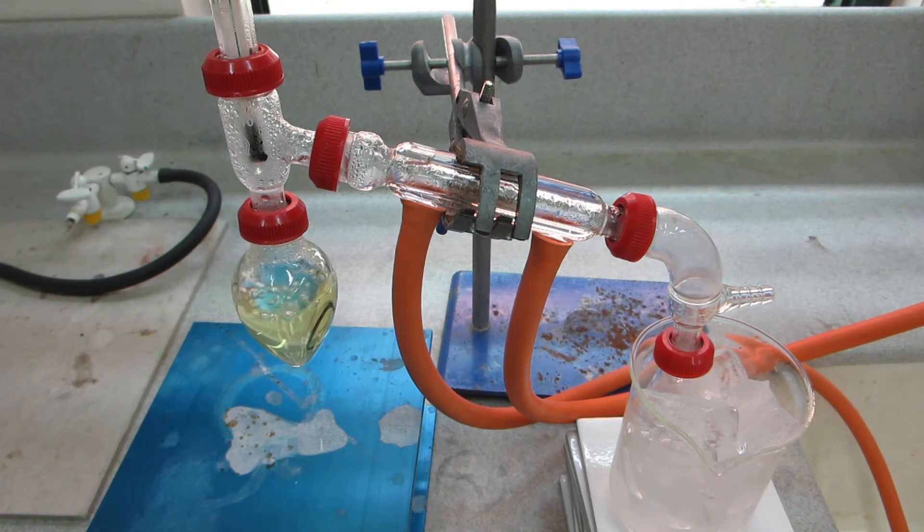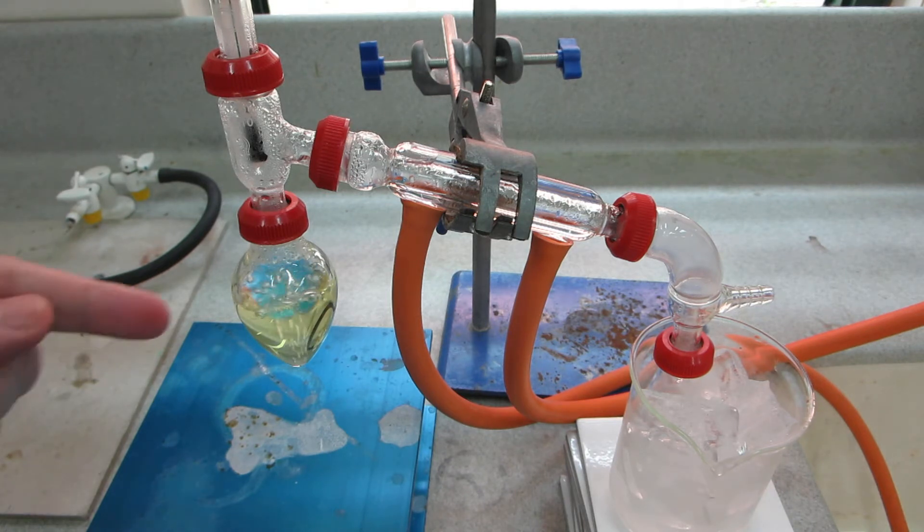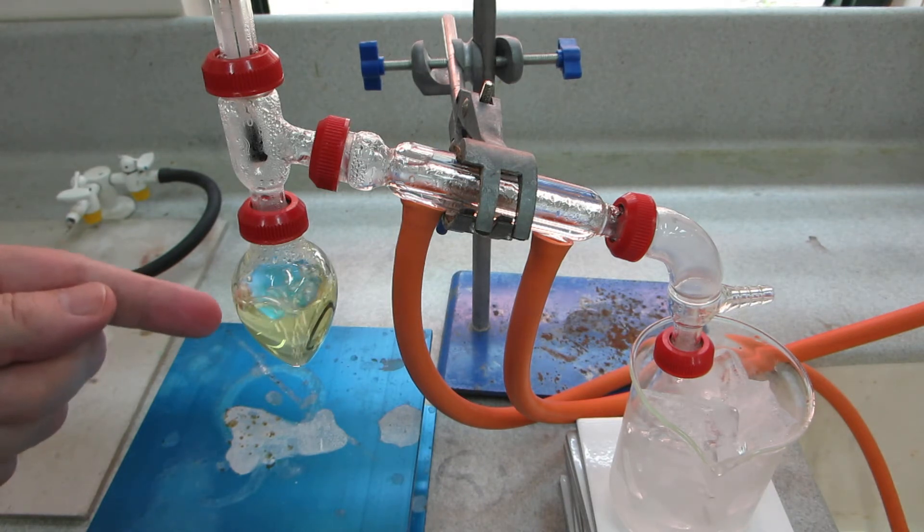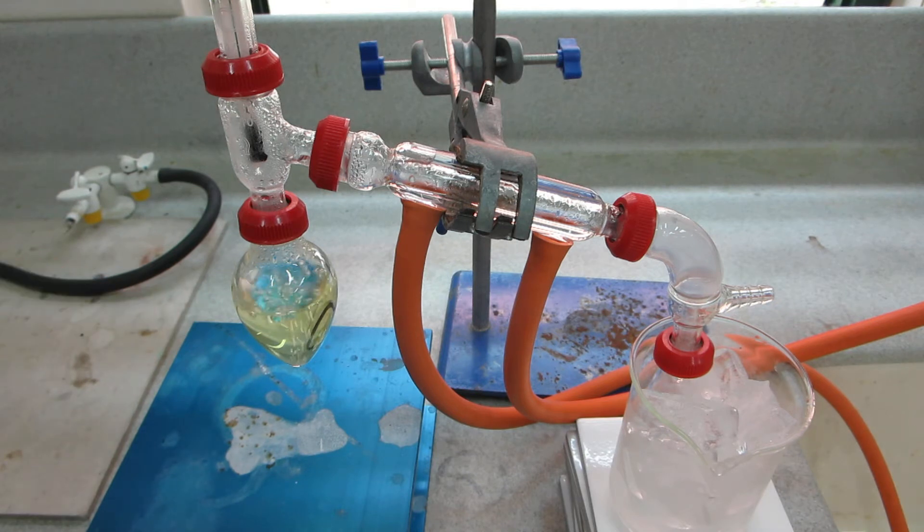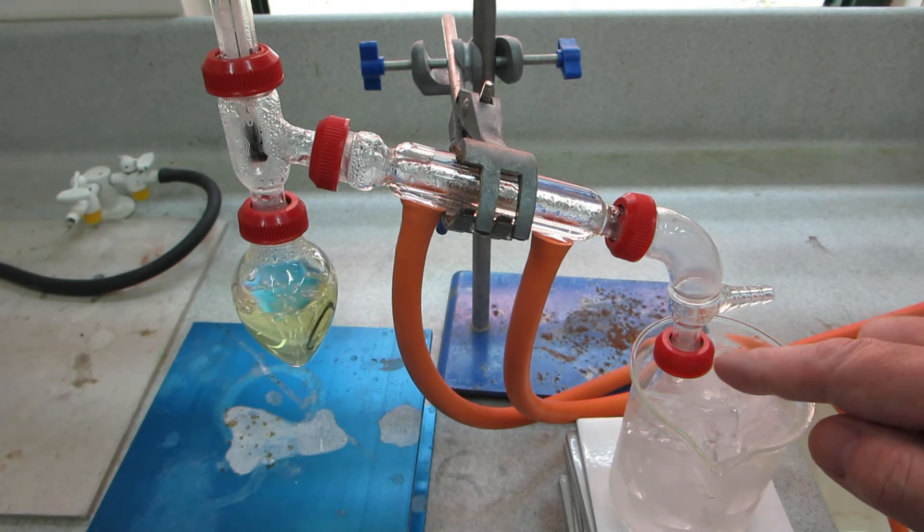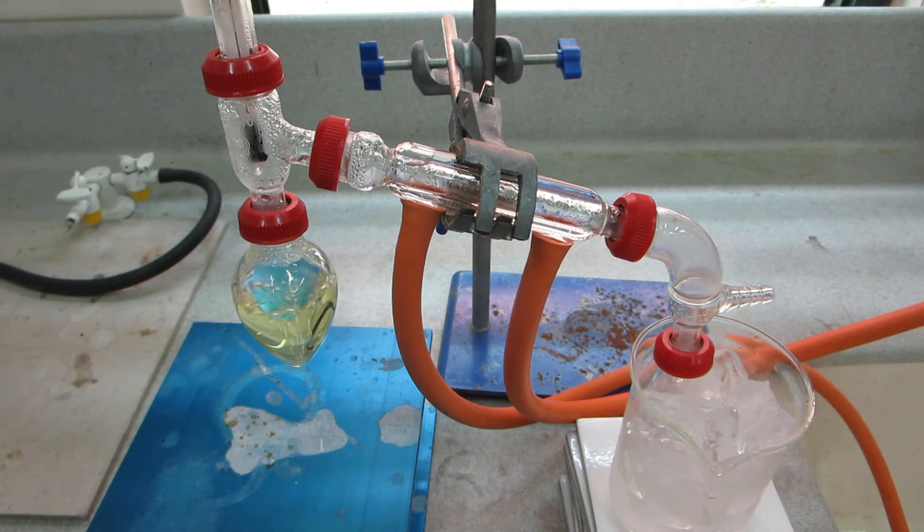Well, the temperature has now started to fall. It's now fallen to 94 and the reaction is beginning to subside over here. So we need to just give it a little bit more time to cool down a little and then we can have a look at the product in the conical flask here on the right hand side.